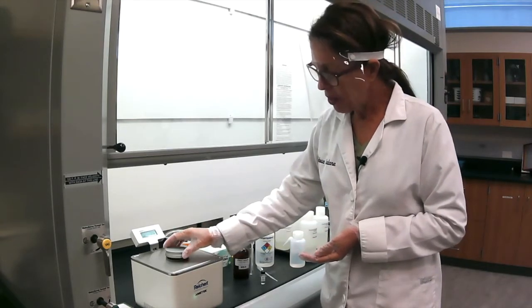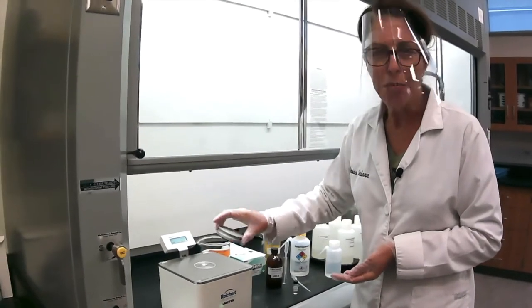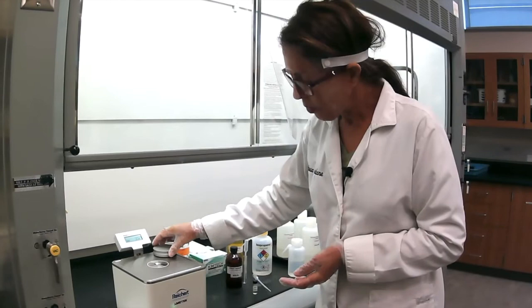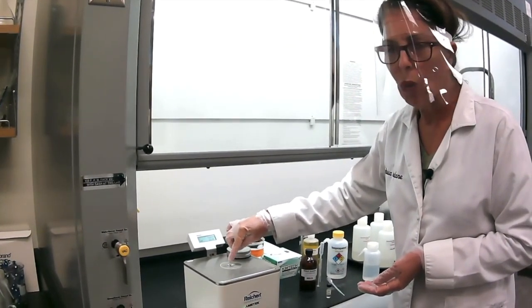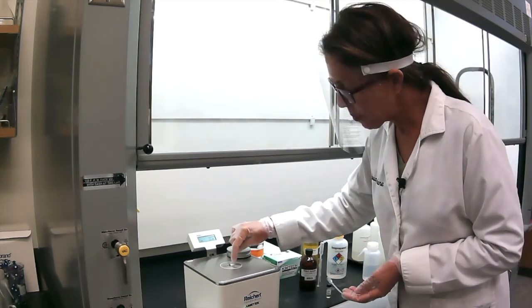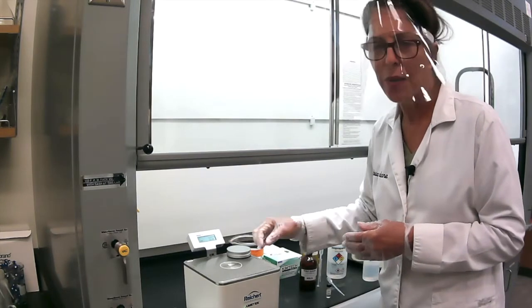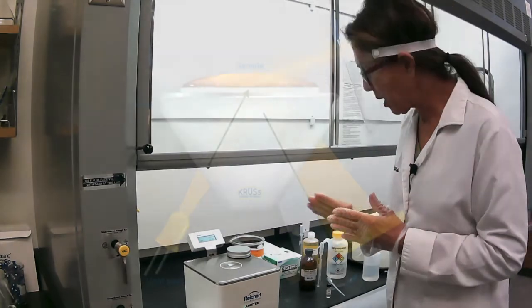So you have here this cap or puck. It looks more like a hockey puck. What you do is, this is just a cover. The whole process happens in this little hole. It's a little container here where you need to put your liquid. And there is a prism. When you look closely, you'll see there's a little opening there. That's where the light is sent through your liquid.